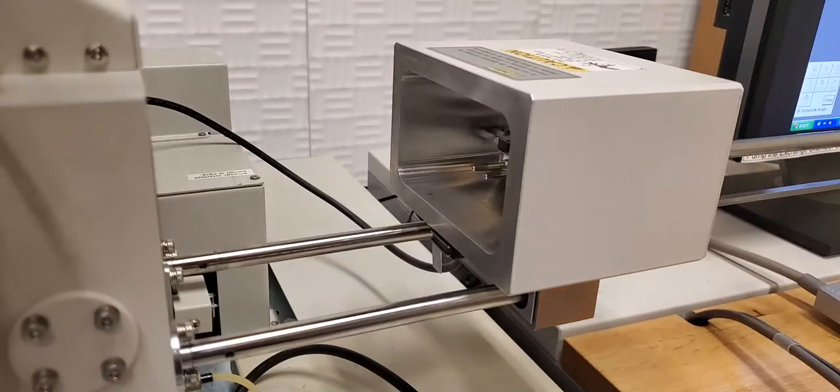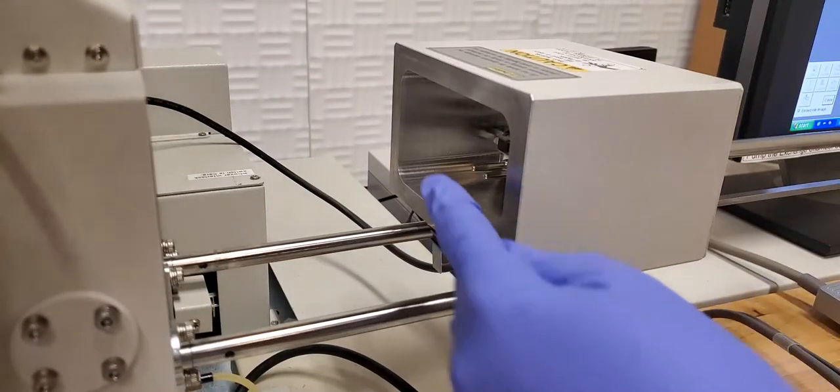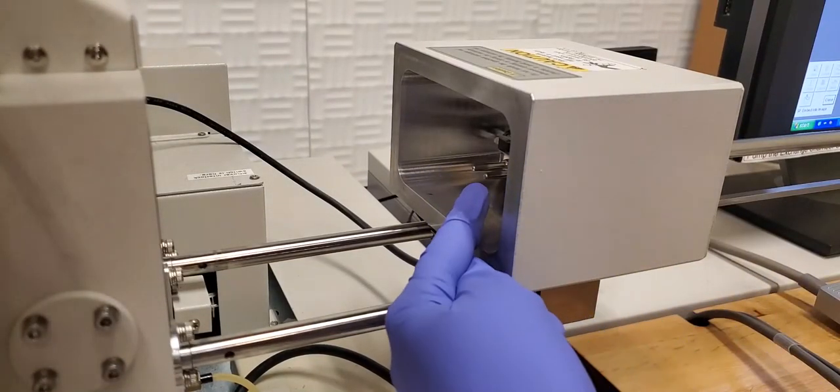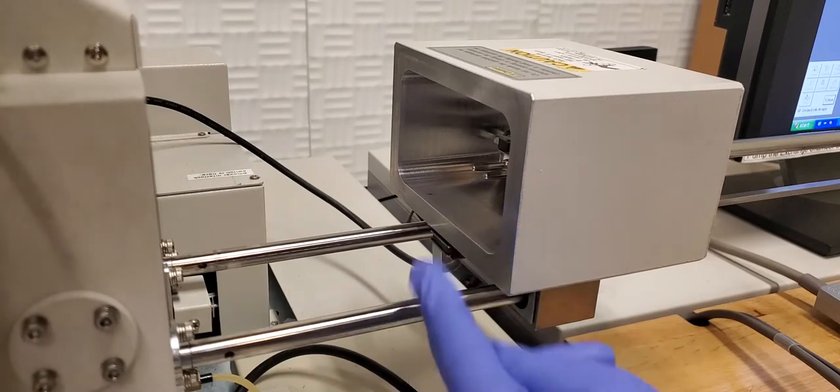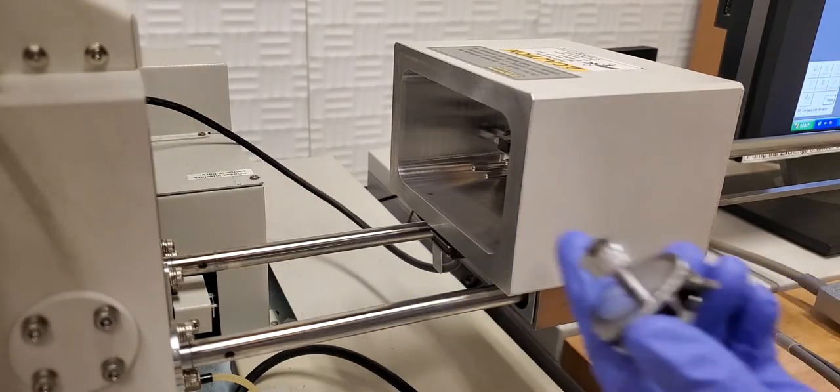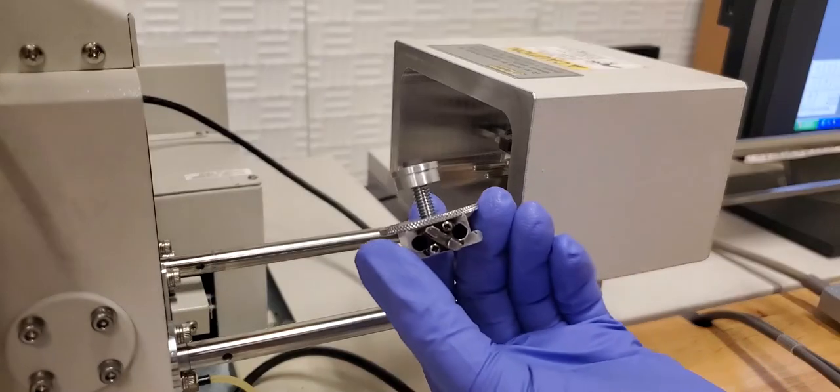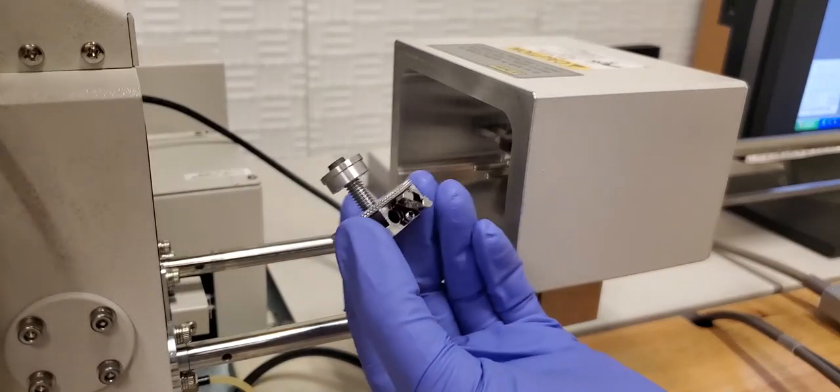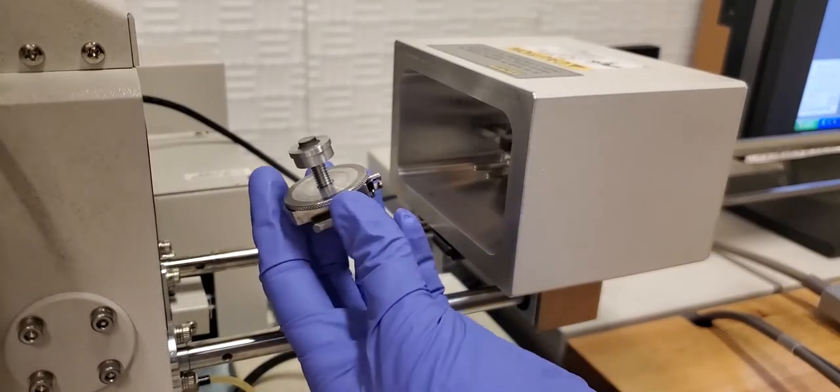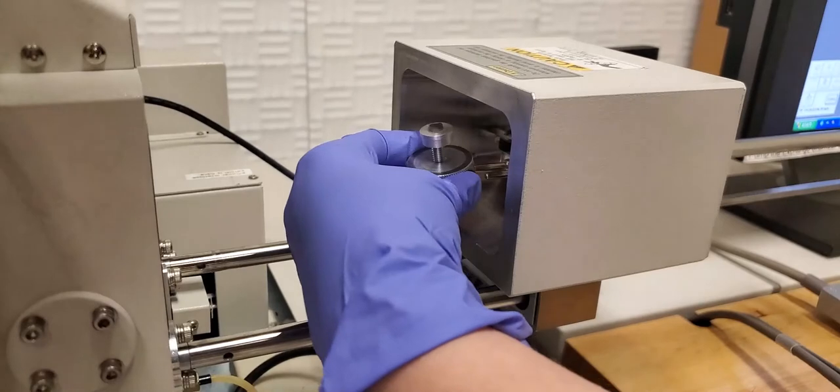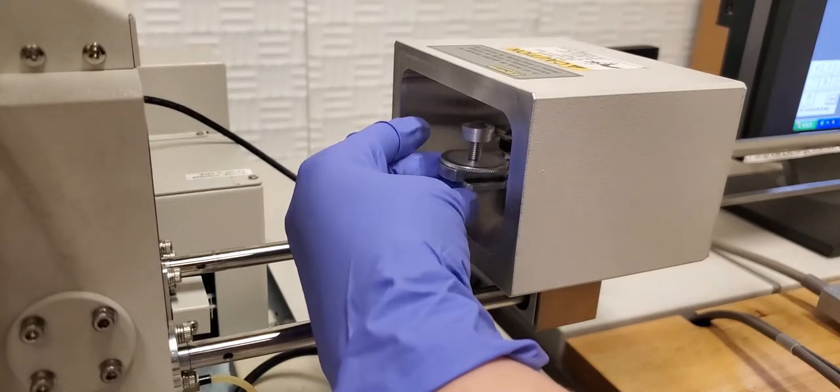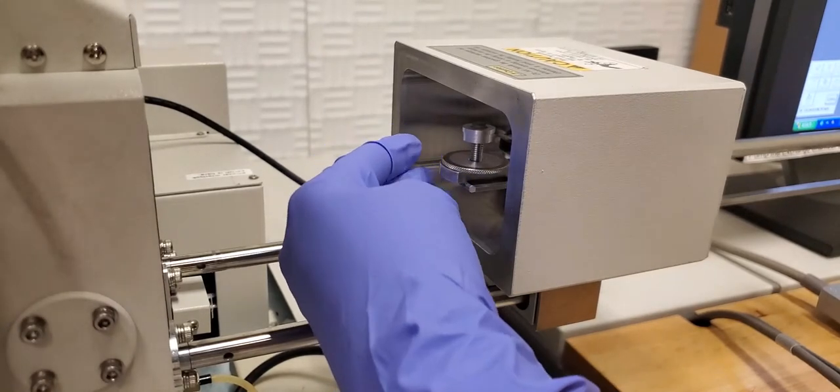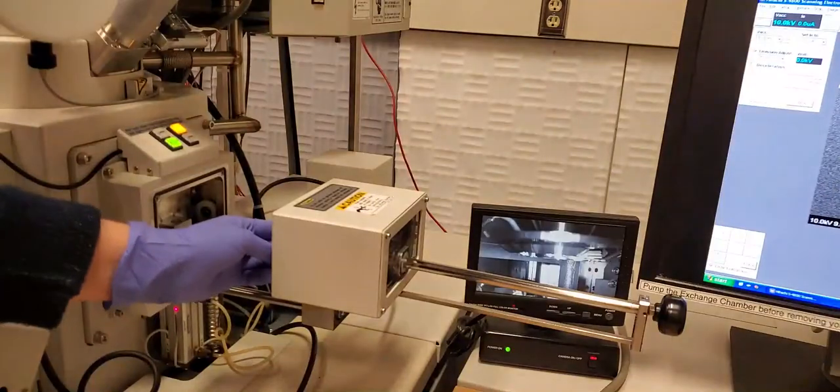Next, you're going to see these two banana clips here, the two prongs here. That's where the sample is going to go. If you look at the base, you can see two holes on one side. Those will be the ones that you slide on. It should feel loose. It's not going to feel super tight. Then you come over to the rod, gently turn it to the lock position.